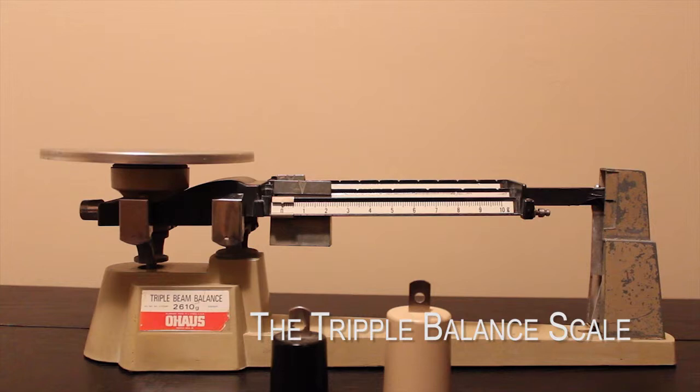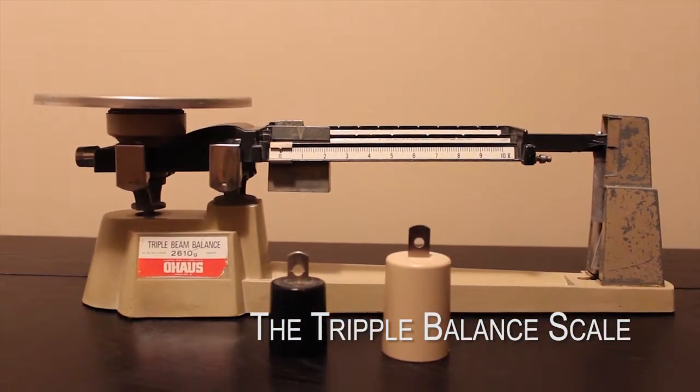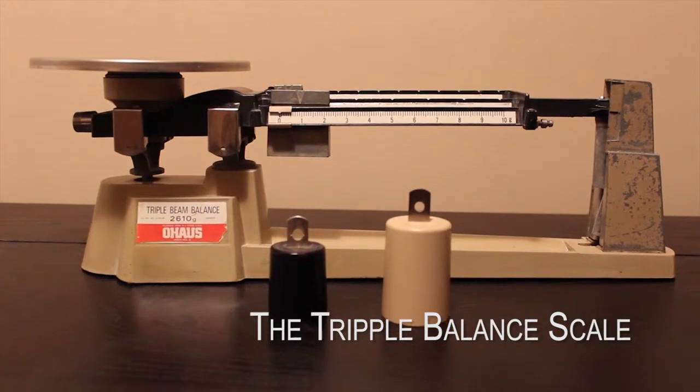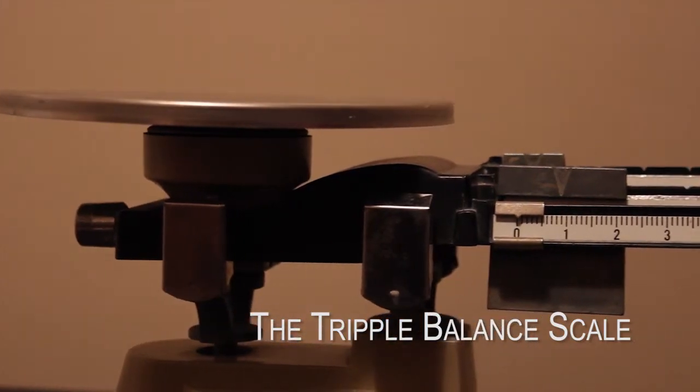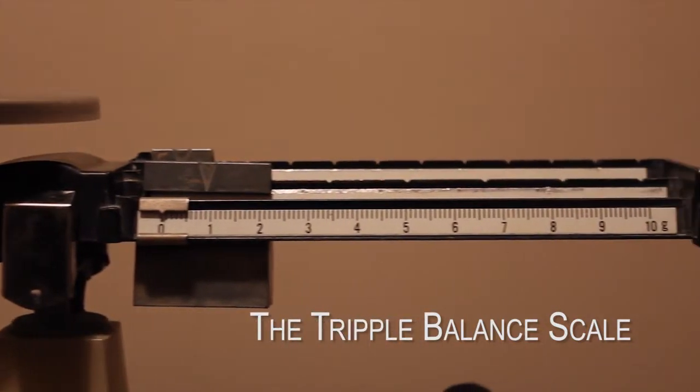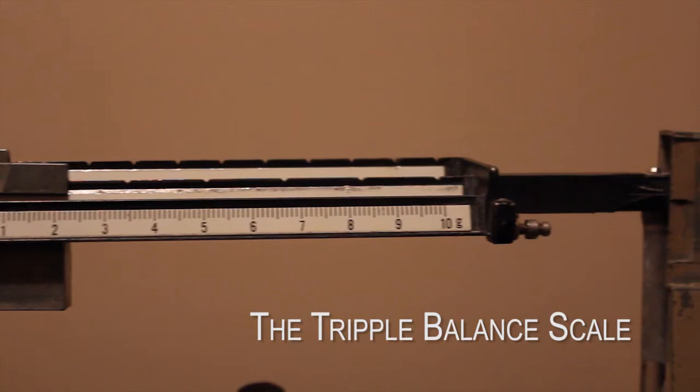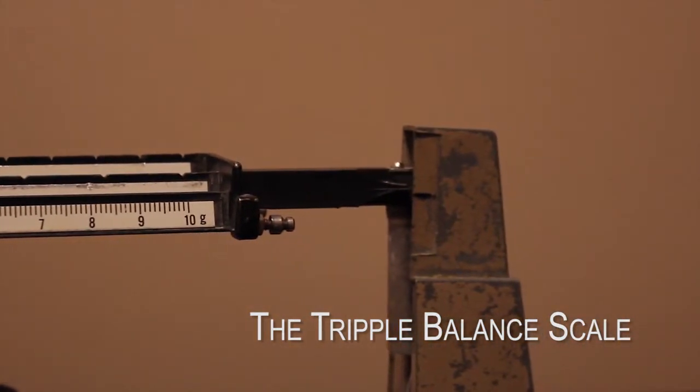The balance scale was the first scale developed in history that is used in medical and pharmaceutical laboratories worldwide. The middle beam has 100 gram graduations, the beam behind that has 10 gram graduations, and the front beam has 0.10 gram graduations.